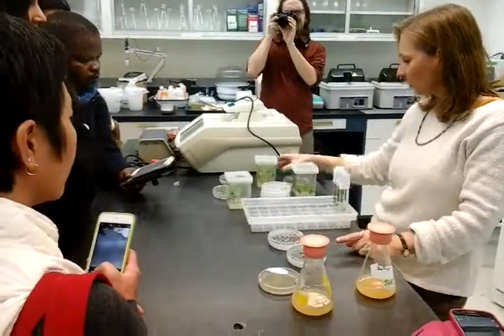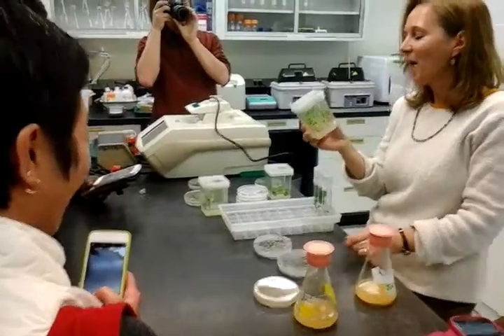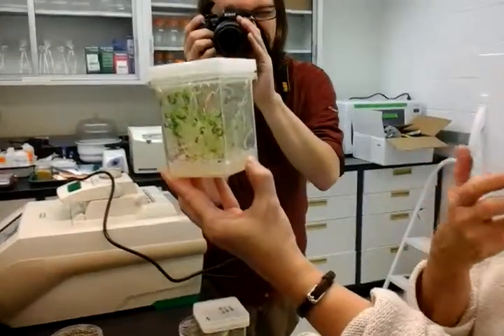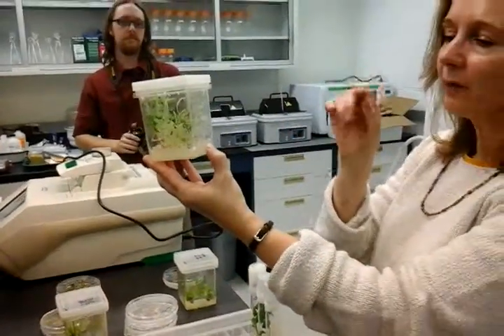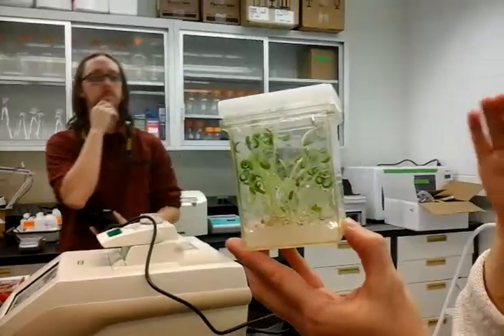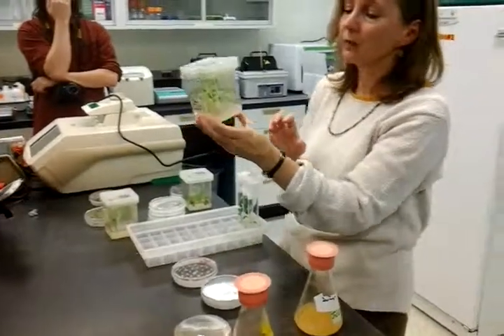For tomato, we're using cotyledon pieces from germinated seedlings. We take the seeds and treat them with bleach and ethanol because they're on a sucrose medium — if we didn't do that, fungi and bacteria would grow. The plants germinate, and after six to eight days — a really fine window — we want to get them before the first true leaves start to emerge. We found the cotyledon pieces regenerate plants most efficiently at that age for transformation.